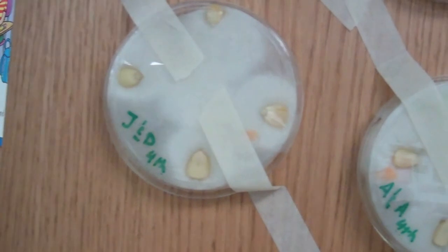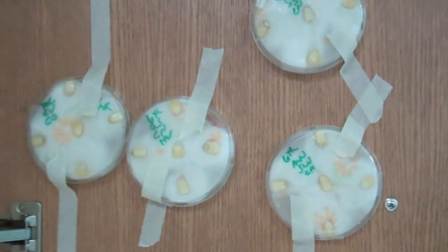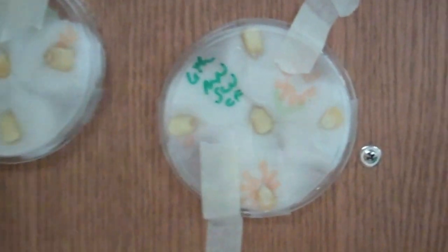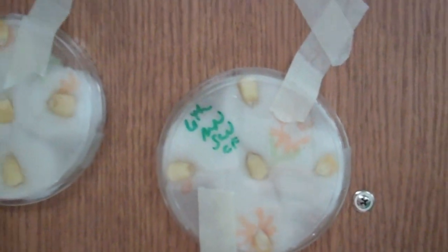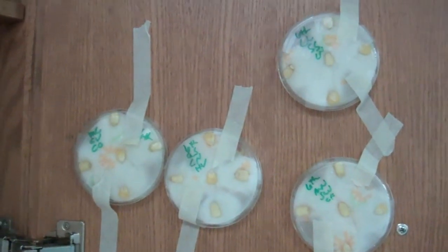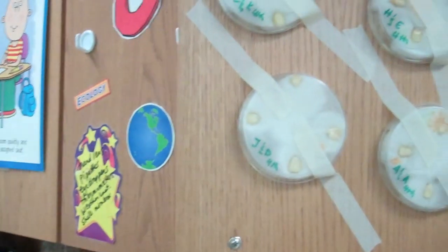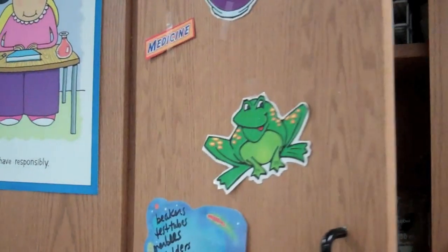Petri dishes are now placed on the inside of a cabinet door by tape for a couple reasons. We don't want light to be a factor in their growth, so they will be grown in darkness. We also place them vertically so that they have room to grow upwards and downwards as we watch the development of their stems and roots to see if gravity truly does have an effect on the way that they grow.